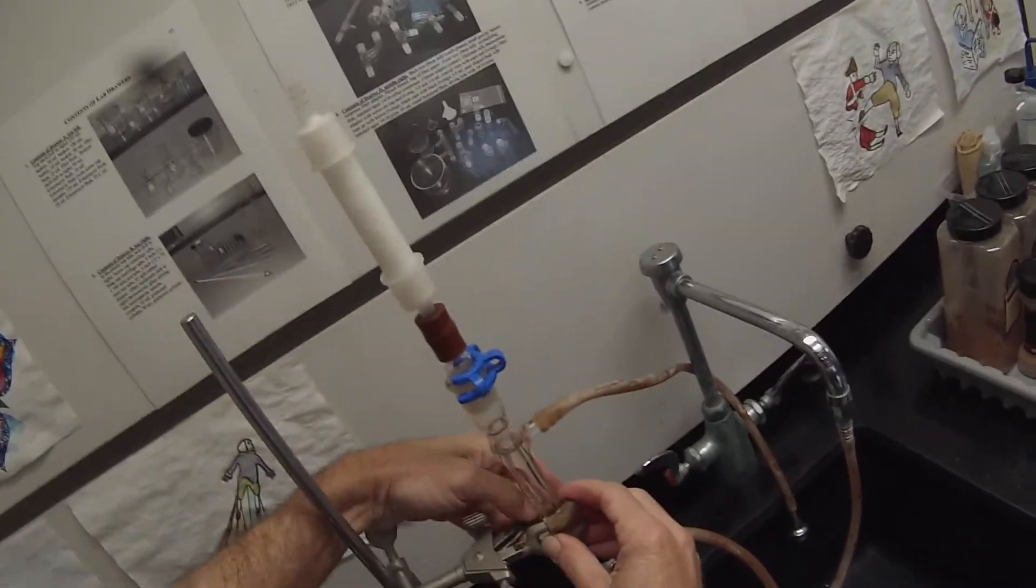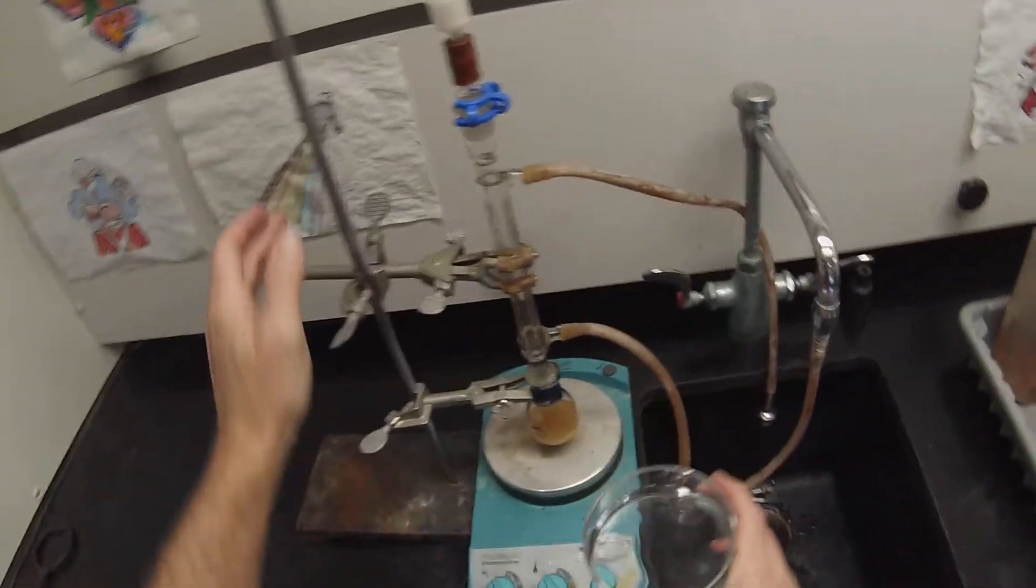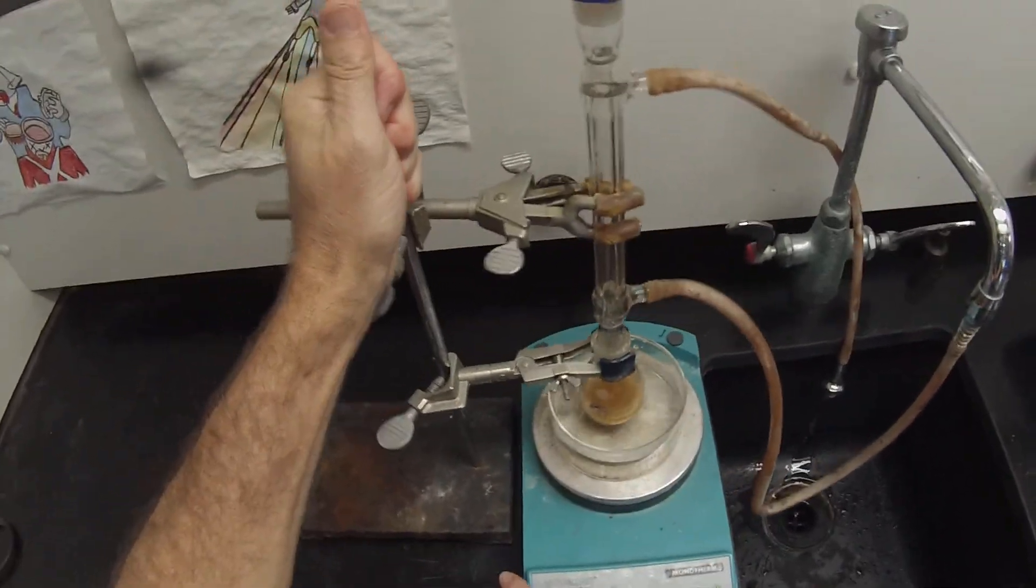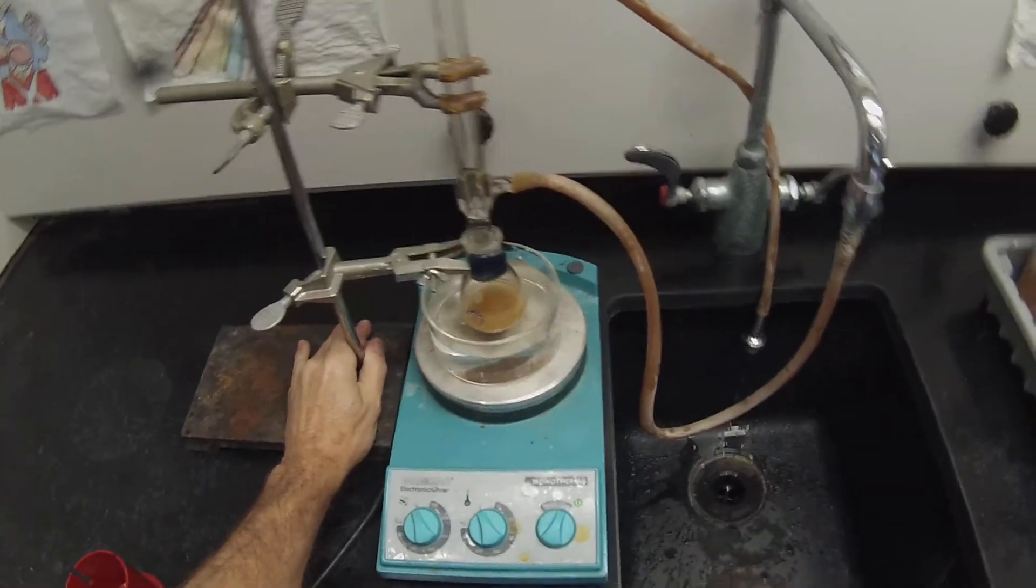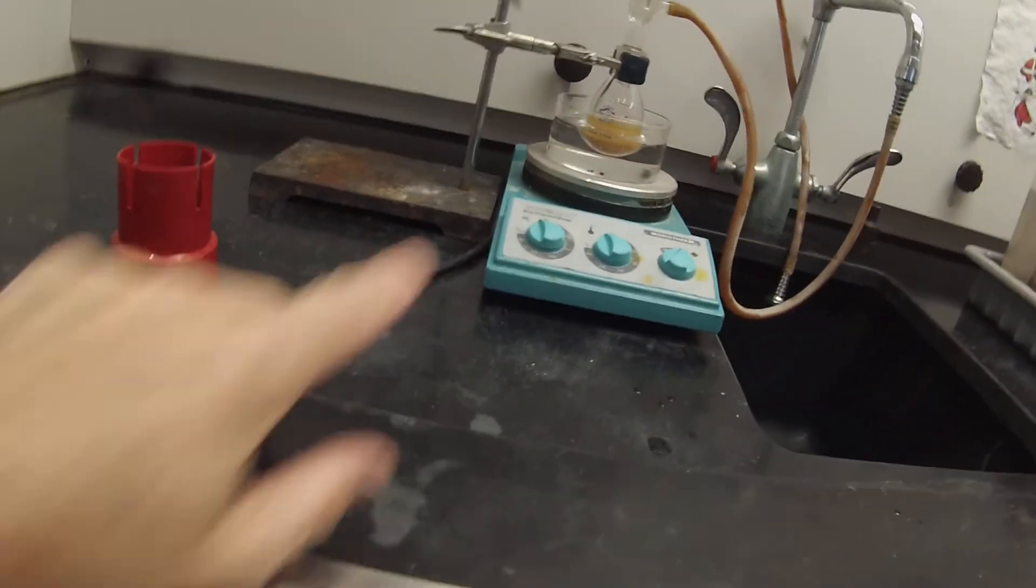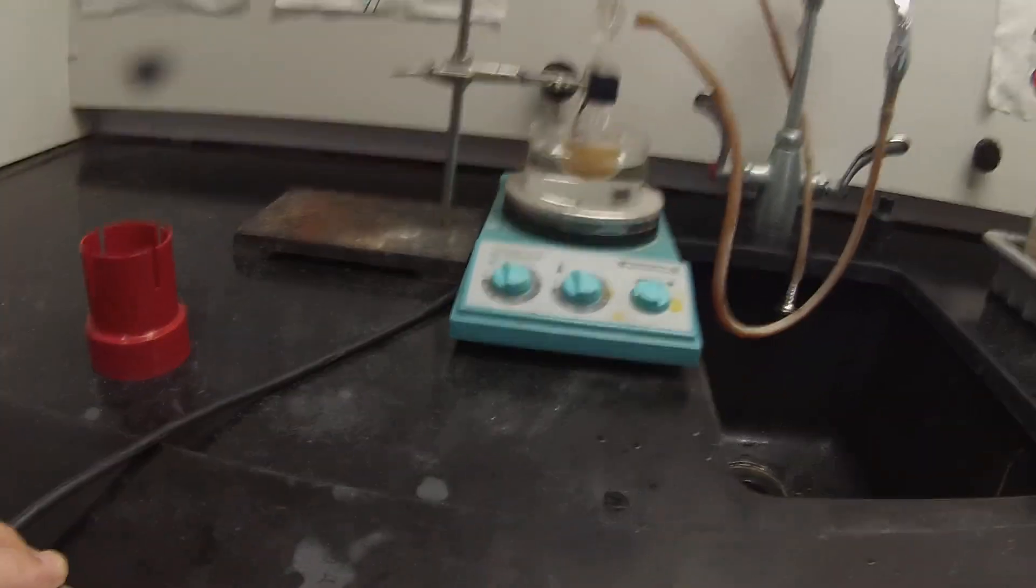So I have my assembly. I'm going to set it in this water bath. And I've got it so that just the bottom part is submerged. You can see that about two-thirds or so of the liquid is submerged underneath the bath.